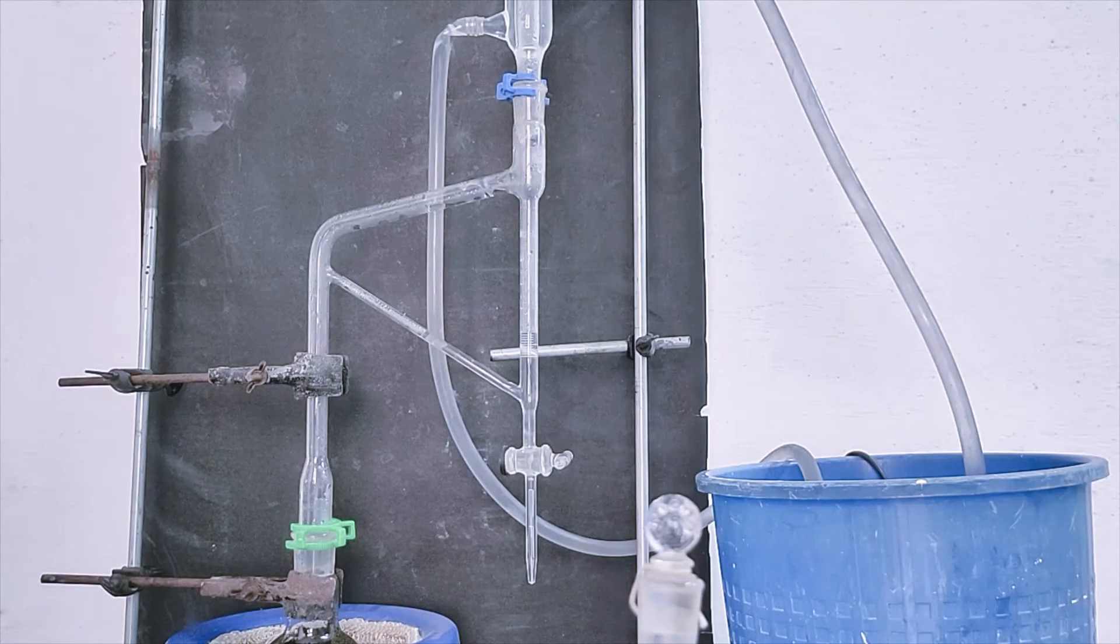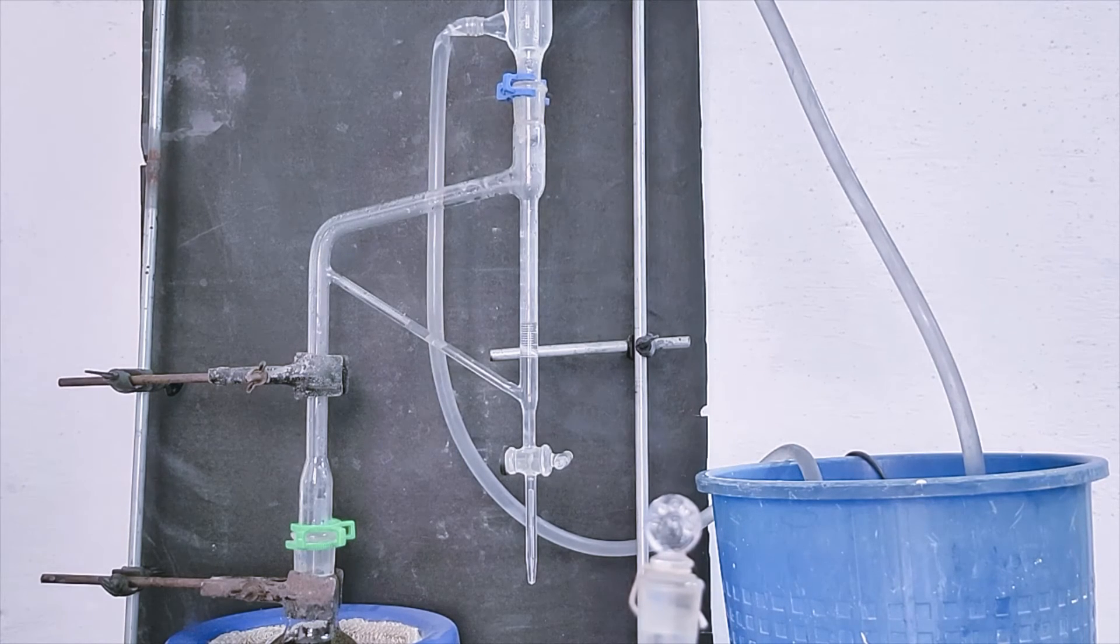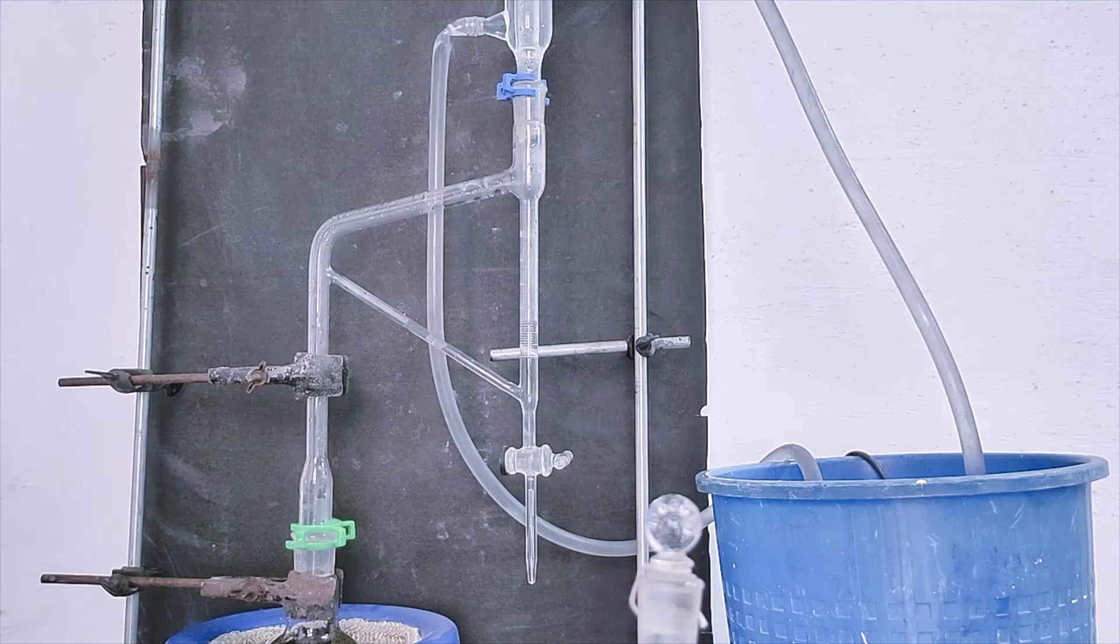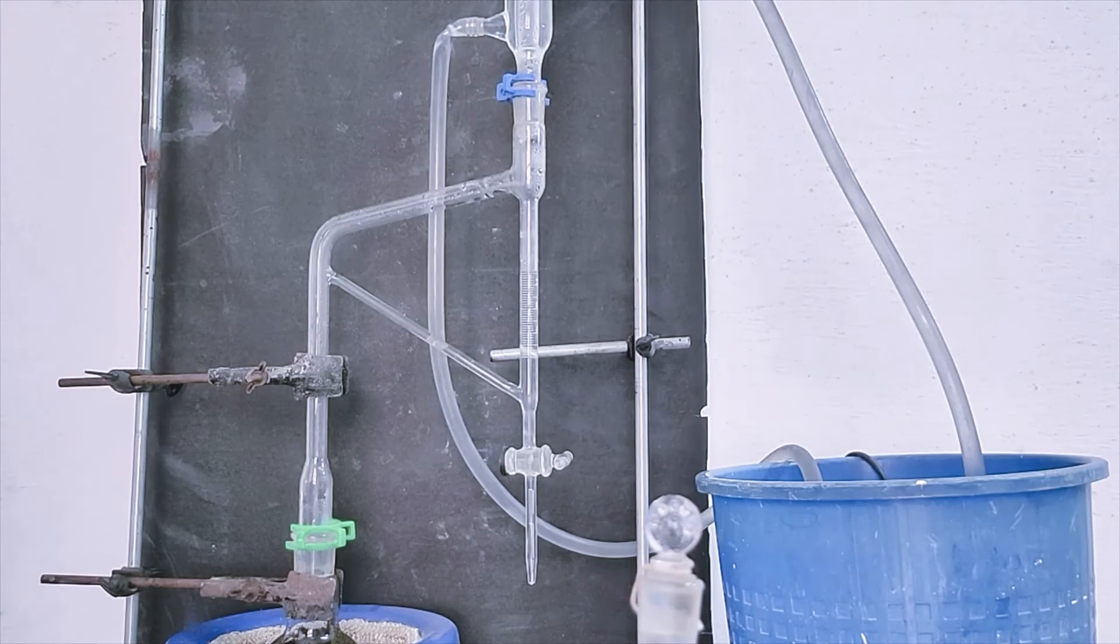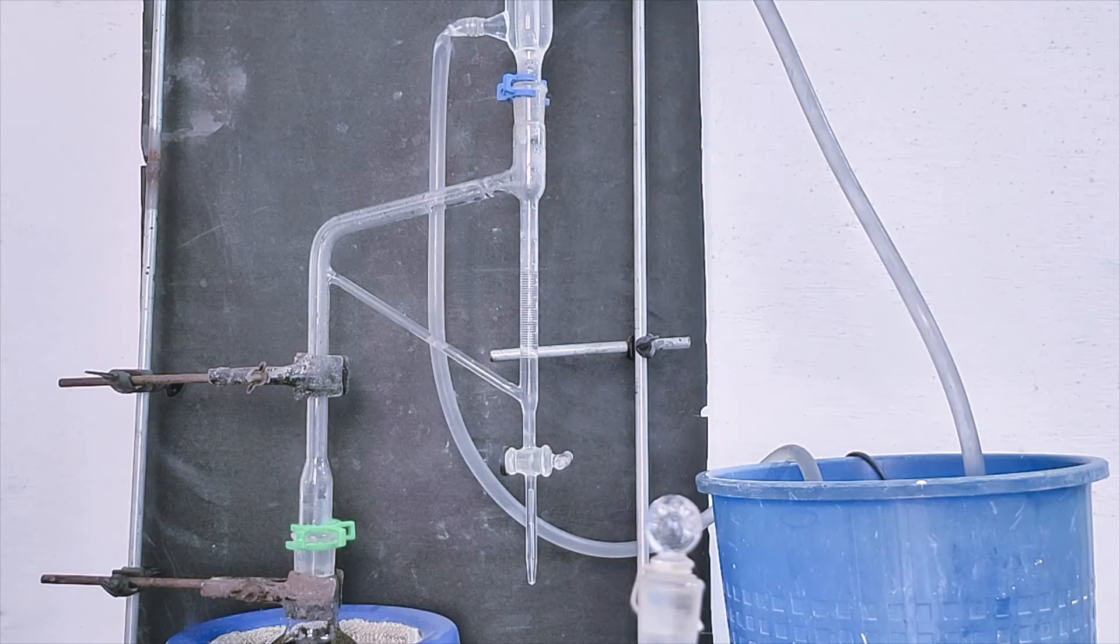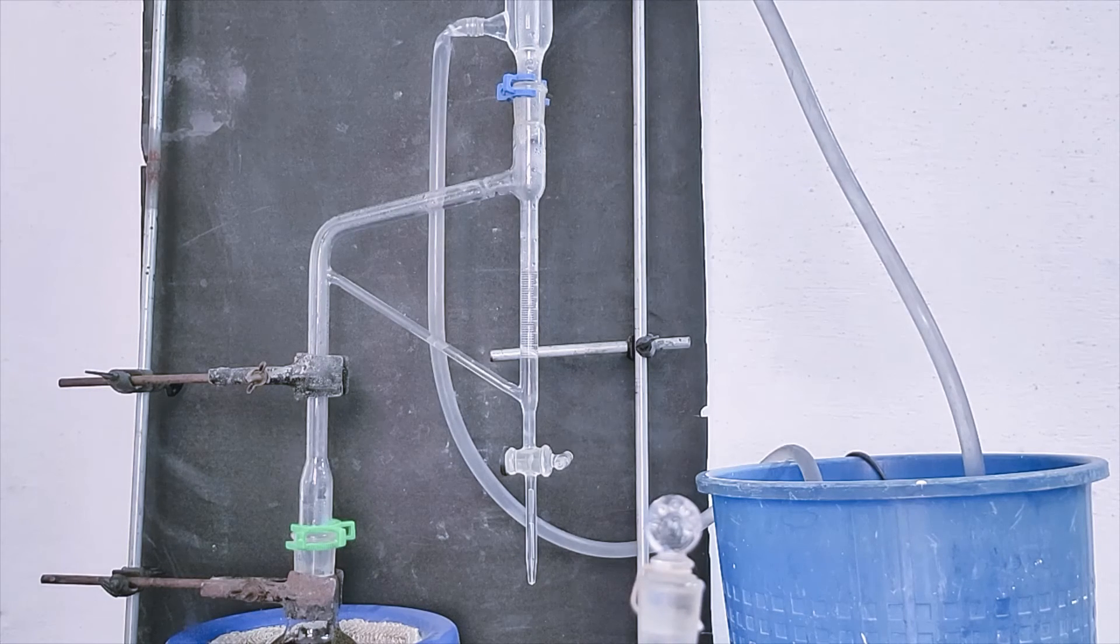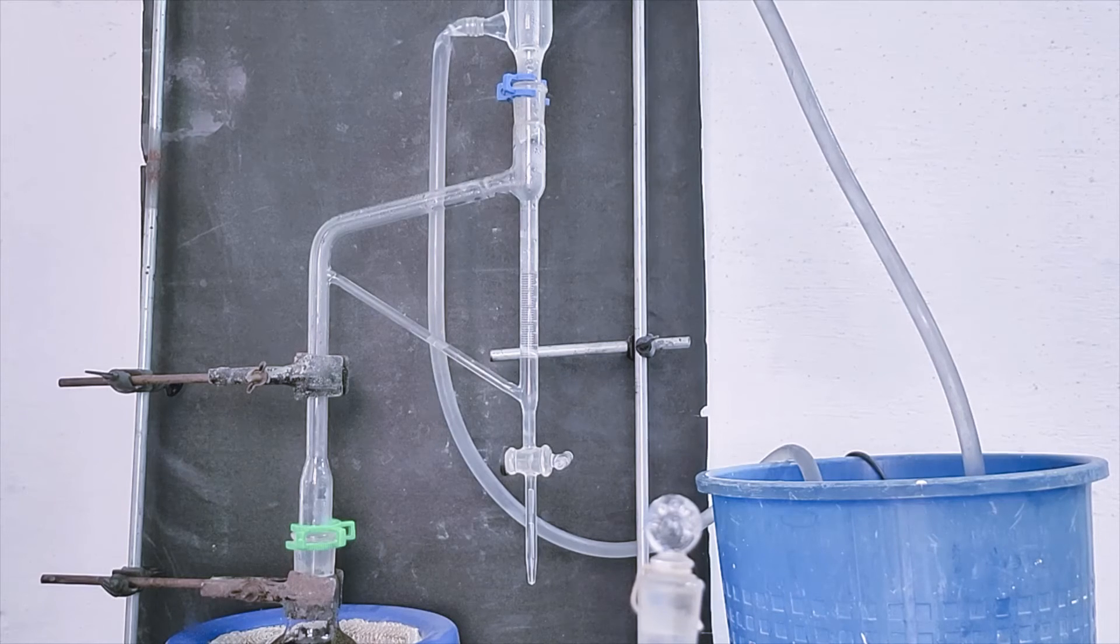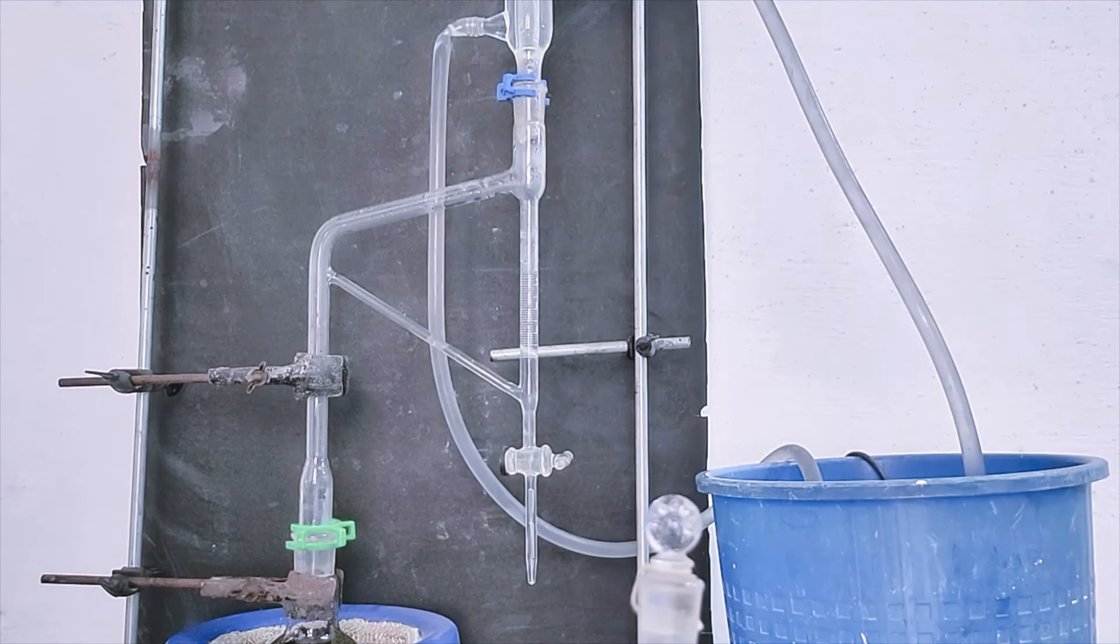Collecting in the Clevenger tube. Now I am collecting third fraction. This fraction has more amount of water than that of essential oil. Collecting this fraction in a separate beaker.